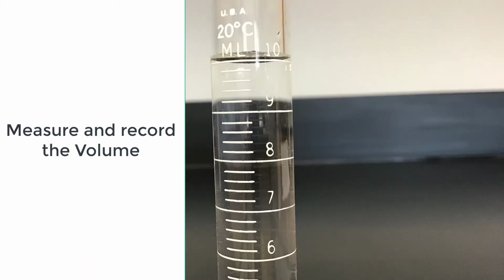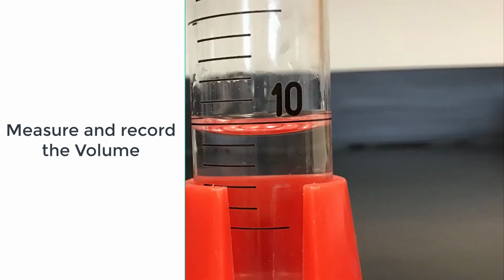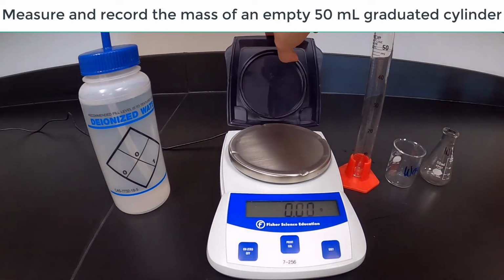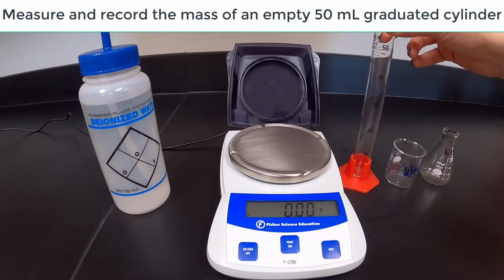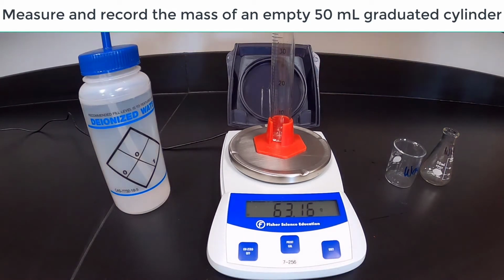Record the volume. Record the volume. Record the volume. Accuracy. Graduated cylinders versus beakers versus flasks. Record the mass of a 50 ml graduated cylinder.